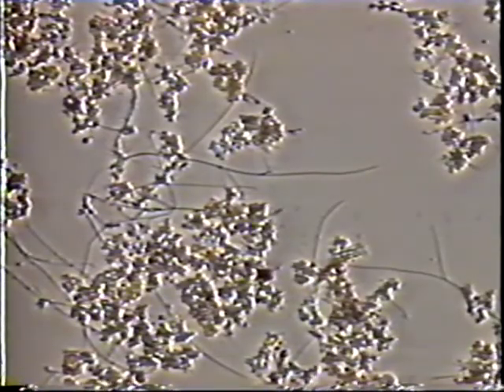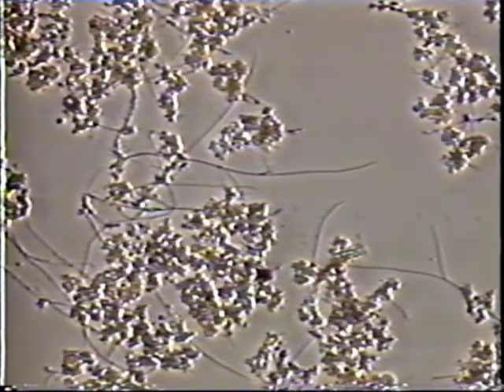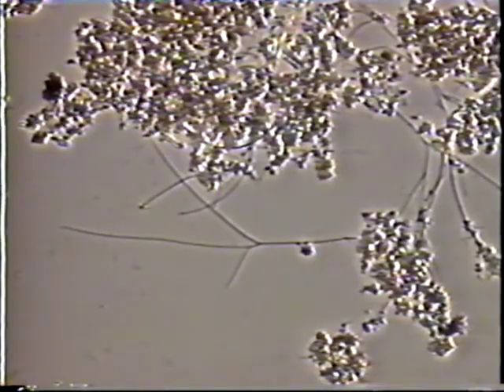We have discussed the causes of filament growth and the conditions at which these filaments are present. Now, let's go under the microscope and look at each of these filaments individually. The next group of filaments are termed low-DO filaments. Sphaerotilus natans causes significant interfloc bridging when the filaments fill the space between the floc. It usually has branching, obvious at low magnification. Sphaerotilus natans has characteristic sausage-shaped cells and a distinctive sheath that resembles a clear soda straw-like tube around the filament.